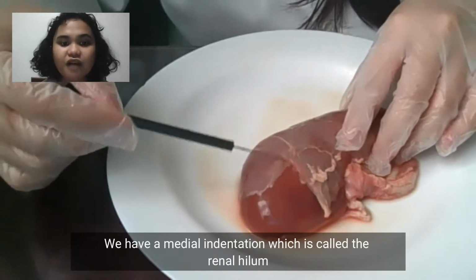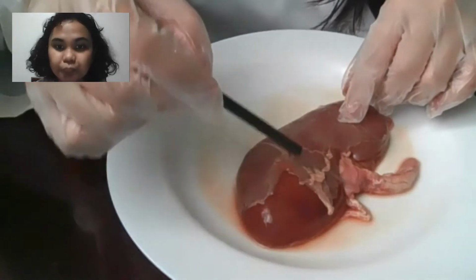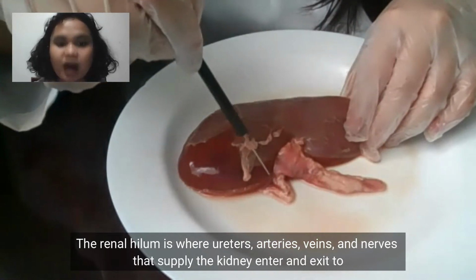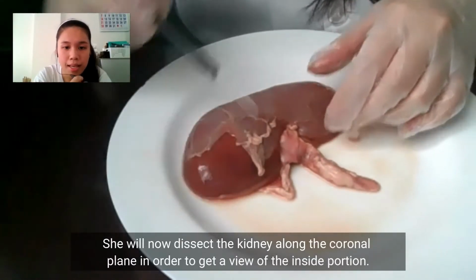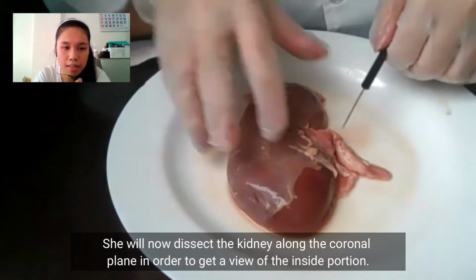Next, we have a medial indentation which is called the renal hilum. The renal hilum is where the ureters, arteries, veins, and the nerves that supply the kidney enter and exit. We will now dissect the kidney along the coronal plane in order to get a view of the inside portion.